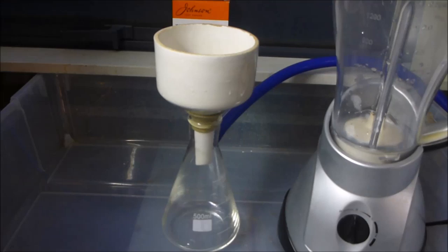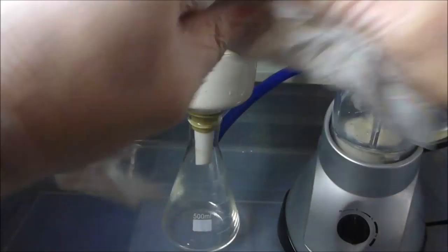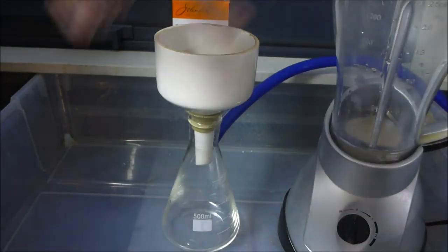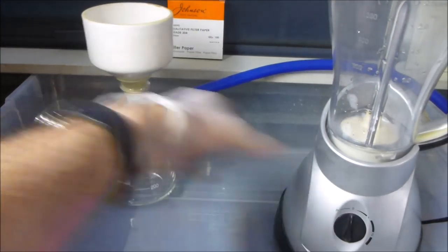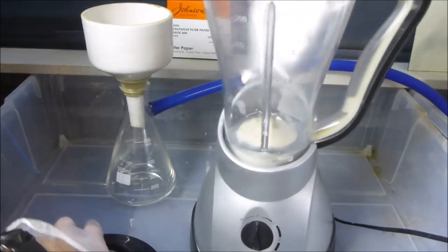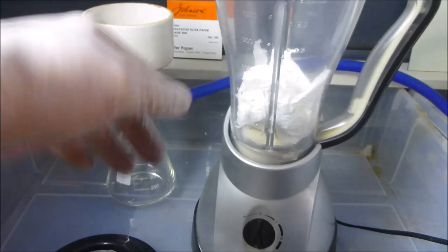So I'm going to grab, say, I think let's go for three sheets of the paper towel, tear it up, and you can tear it up into a few smaller bits. Basically, I tried blending dry paper towel and it didn't work too well. So what we're going to try now is to do this semi-wet. So we're going to poke the paper towel in there.